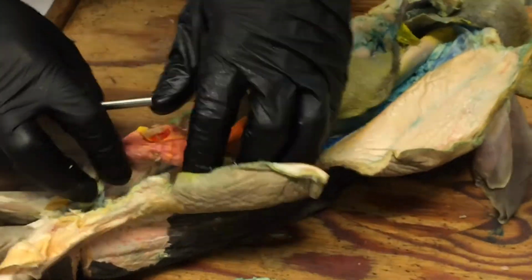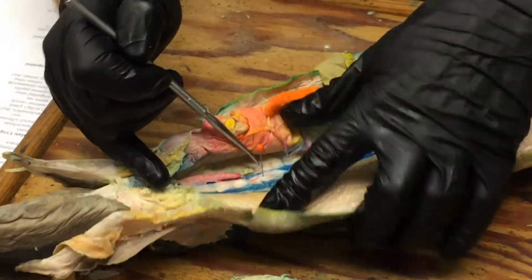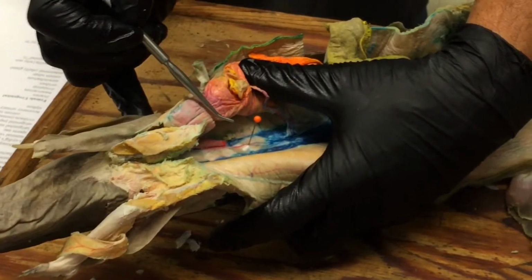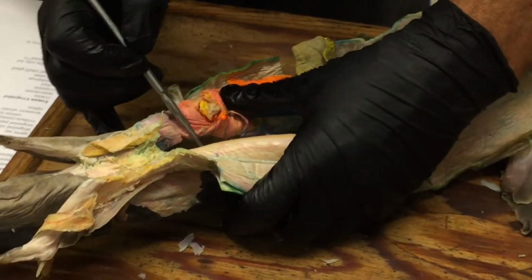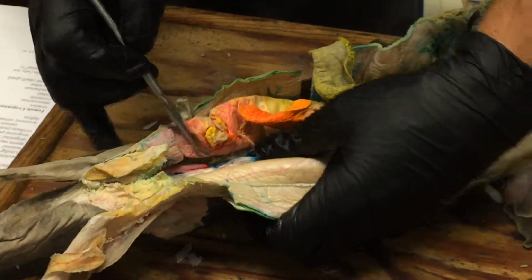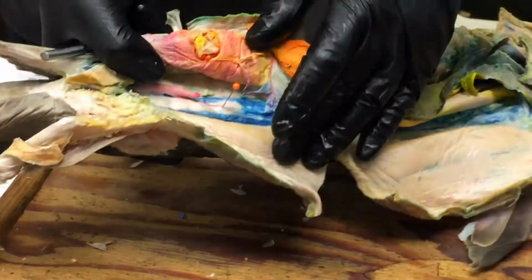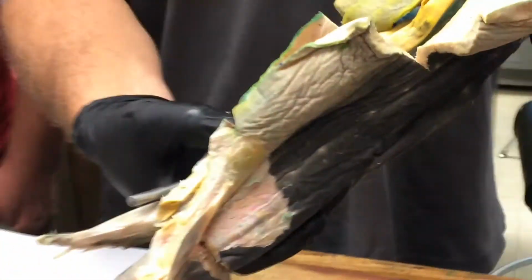The caudal ligament shows up as a term here. And that's mostly just so that you don't confuse it with anything else. It nicely has a pin in it. Is that what that's supposed to be showing? Or is the pin just there for? Well, that was for the artery, but it sort of missed the artery. Yeah. I would get in trouble if I did that on an exam. But right in the midline, you'll see this kind of shiny band of connective tissue, and that's the caudal ligament. And the point of it is just that this is not part of any of the stuff we're looking at. It's just there, and not to confuse it with the ducts of the kidneys and such.